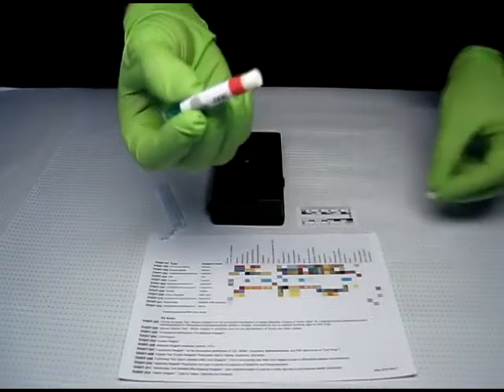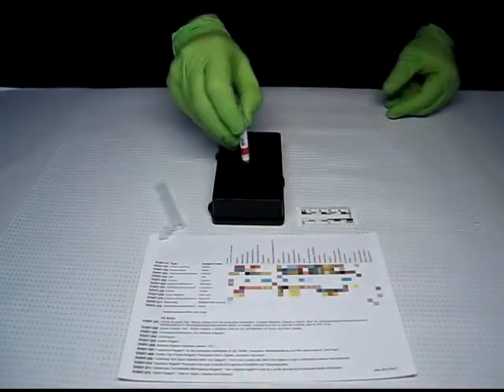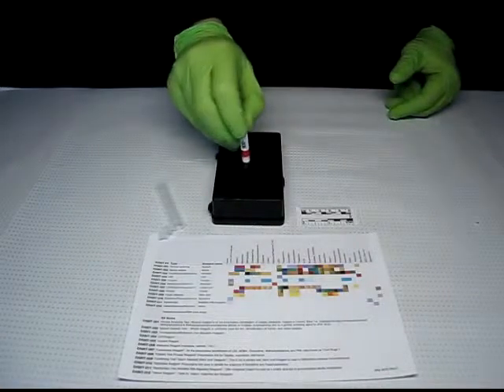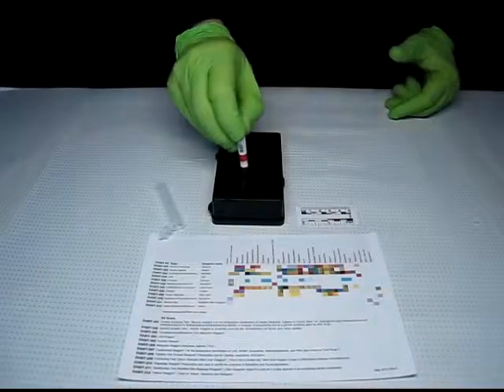Dab the sticky sampler tip on the material to be tested. Replace the sampler into the clear outer tube, tip first. Close the cap.